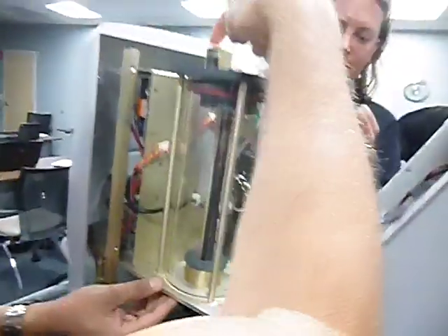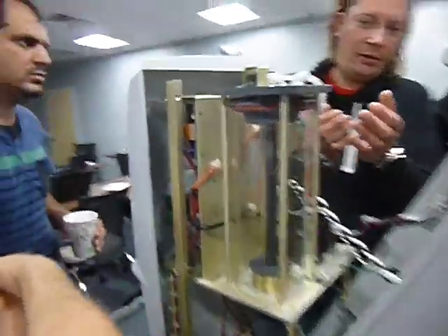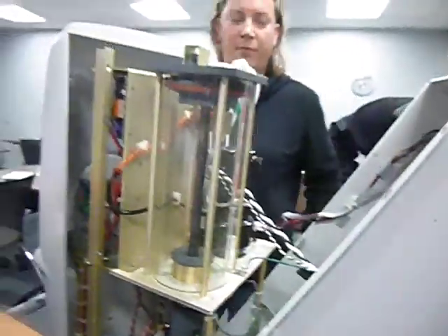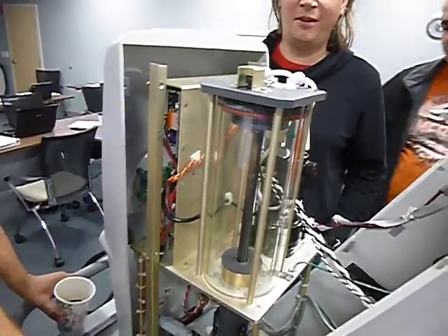The only thing which is missing on this instrument is something that would catch the leakage and put it out of the machine. That would be good. Yeah, then it would be a few thousand dollars more.